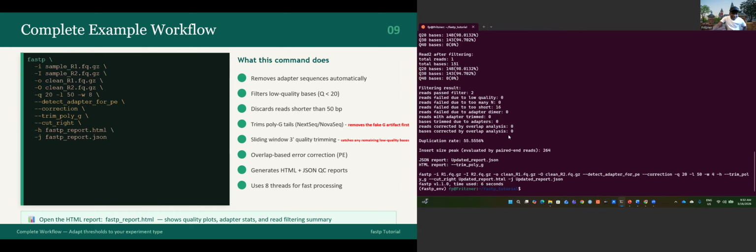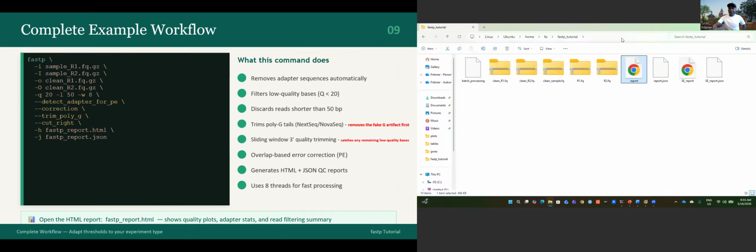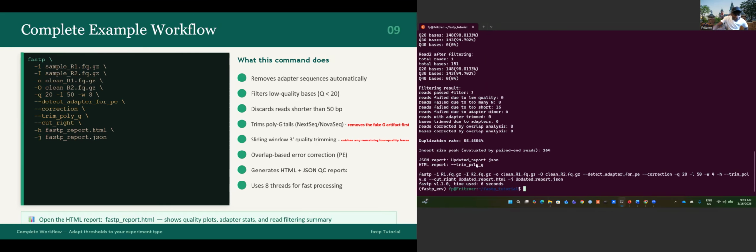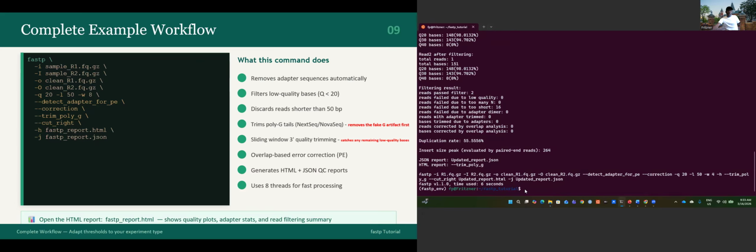It tells you almost the same thing. You'd say it's completely different. Let's try to open them and see. Let's refresh that. I think I probably did something wrong. I have the updated report for the JSON, but I don't have it for the HTML. Let me see. It might be something with my computer speed, because it worked for the JSON when I changed the name. It should also work for the HTML. You can try it to see. Maybe it worked for you. Maybe it's something related to my computer.